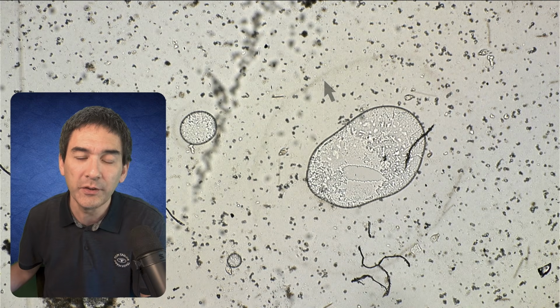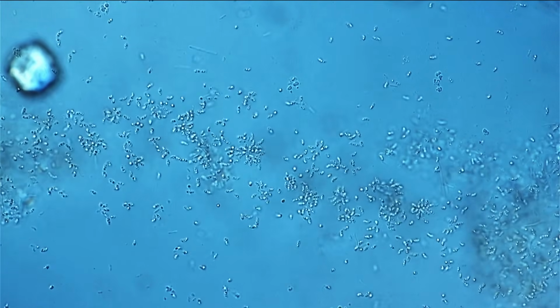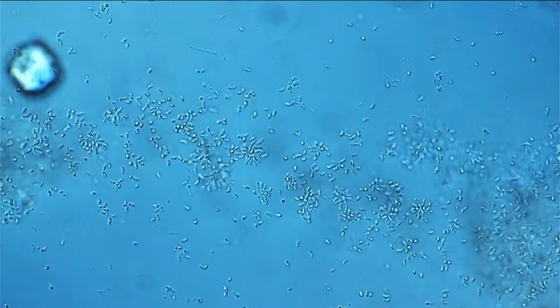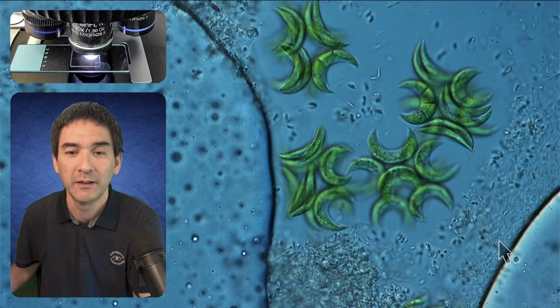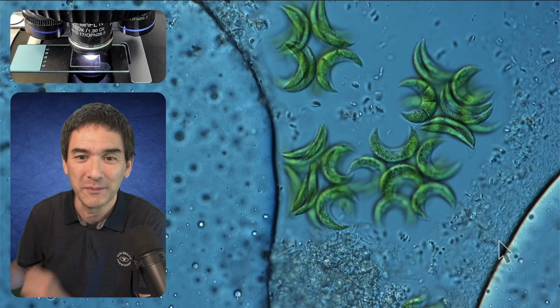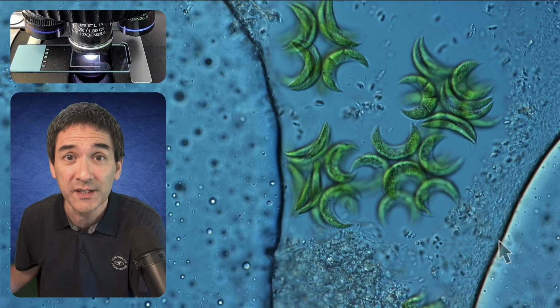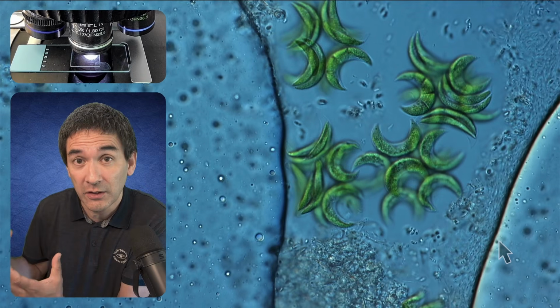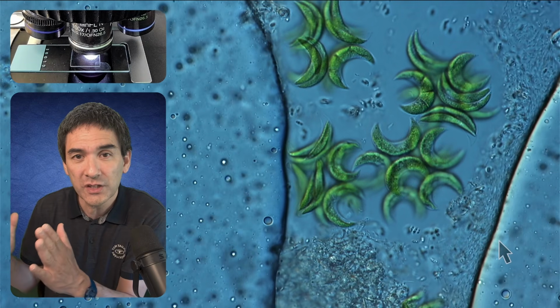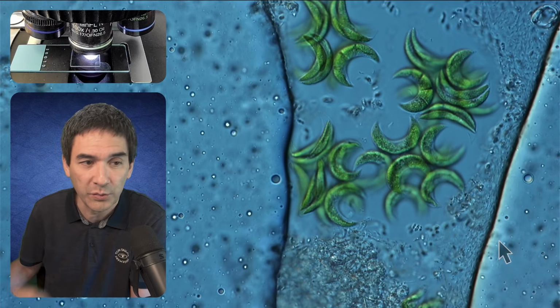Right, and now the question is, of course, why do the bacteria do that? Why do the bacteria form this ring? And obviously, it is because they need oxygen. Like we've seen before, we can also see air bubbles moving in from the side. Those algae also produce oxygen by photosynthesis. But the interesting question is, if the bacteria like air, oxygen rather, why don't they just completely move towards the air bubble or towards those algae?